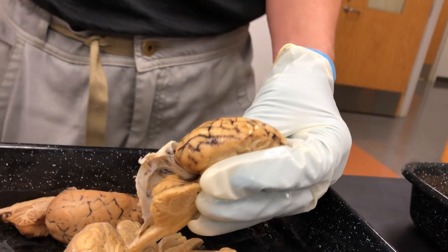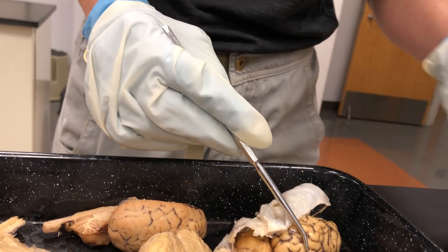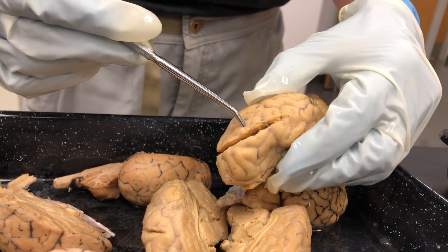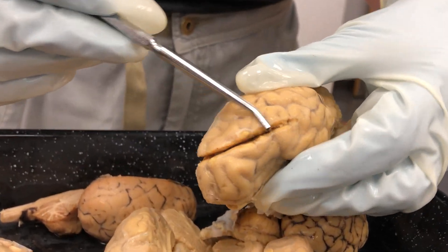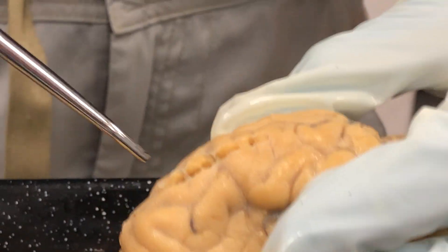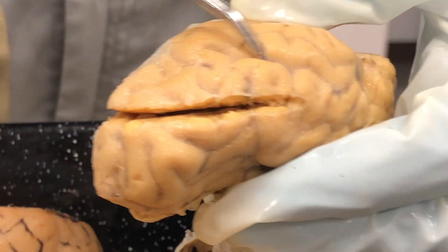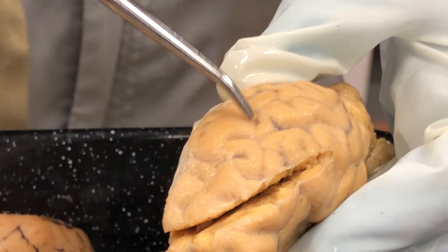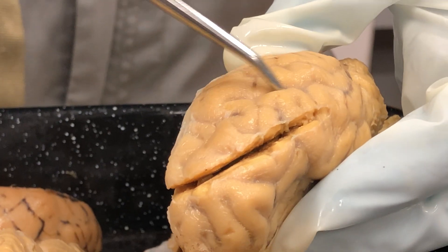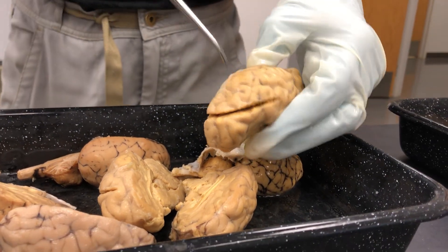The next item on the list is the pia mater. The pia mater is a very thin surface coating of the brain — you can see a little bit of it peeled up right here. It's a very thin, fine coating. Pia means delicate, whereas dura means hard, and it basically follows all the grooves and shapes of the sulci and gyri. The gyri are the convex sections of the brain and the sulci are the indentions in between the gyri, so the pia mater follows the contours of the gyri into the sulci.